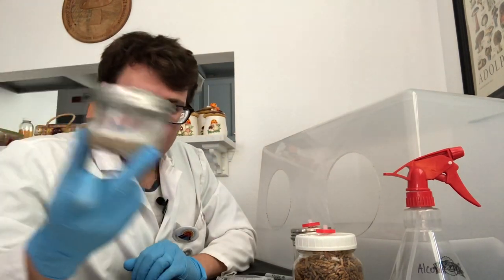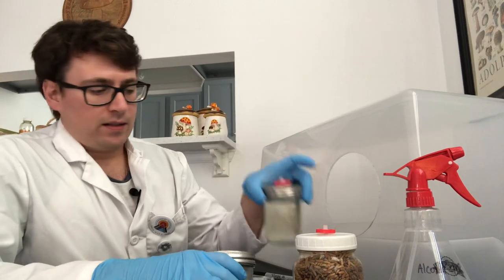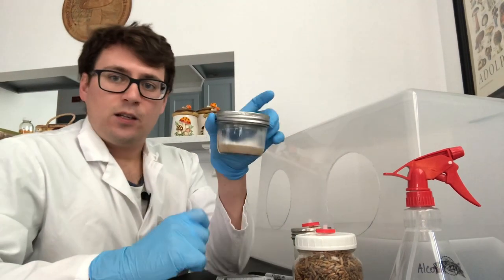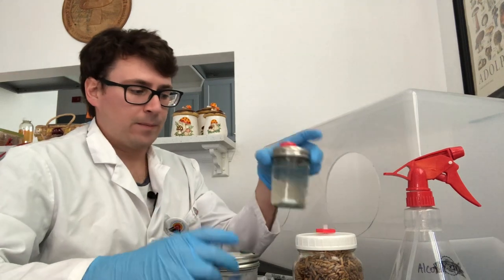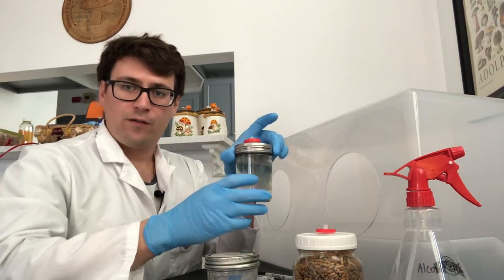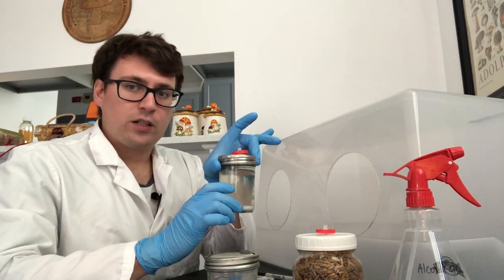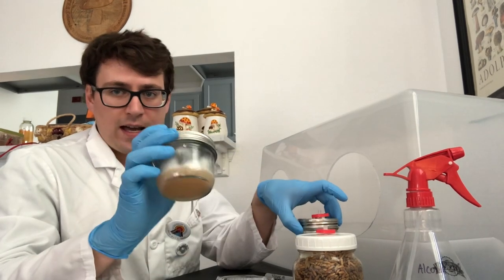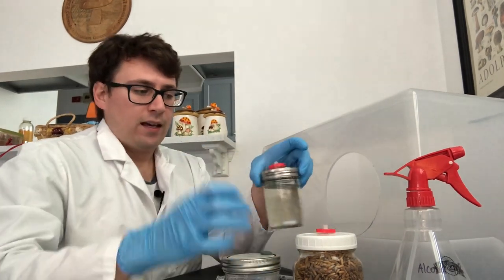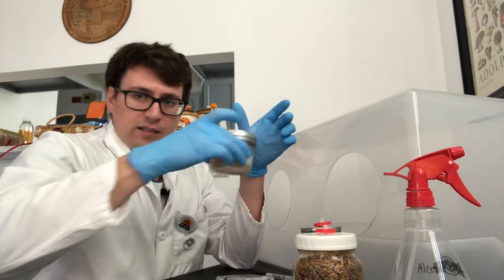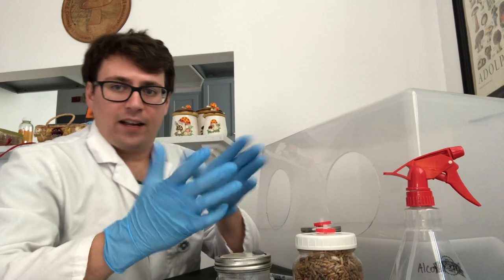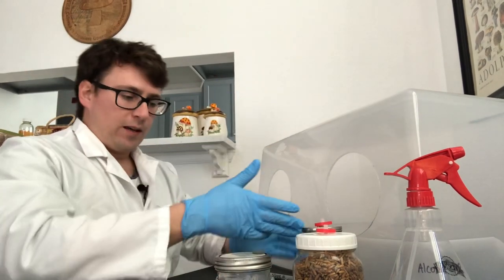That way you can quality control your liquid cultures. This is another useful tool because you can take sterile media. So if you sterilize your liquid culture but you didn't have any cultures and all you had was the no pour plate, you can pull that media, inject it into the jar, stir it around, and then you'd have an inoculant for your liquid culture.